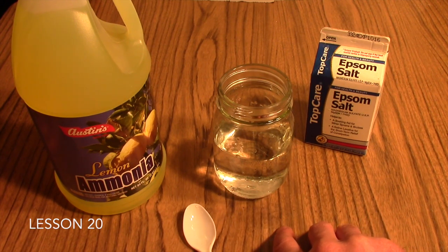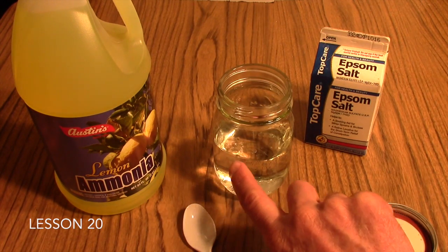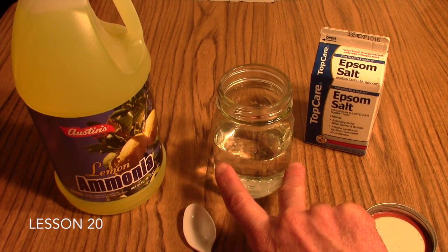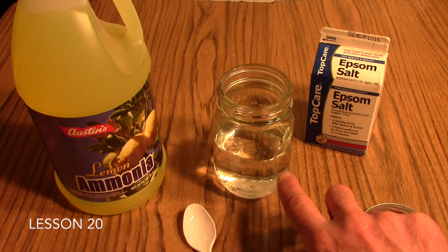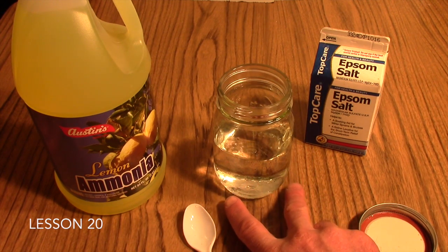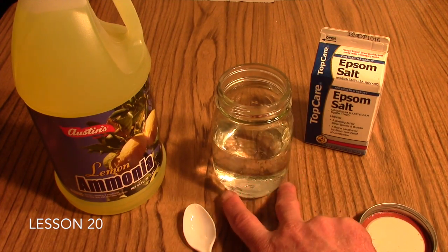If you come back an hour or two later, or even let it set overnight with a lid on top, you'll find that the cloudiness — the new compound that formed in the solution, which is actually magnesium hydroxide — those little chunks that were once floating around and made it cloudy have now settled out. They have fallen out of solution, and that is the precipitate: a solid has formed that is no longer soluble in the water.